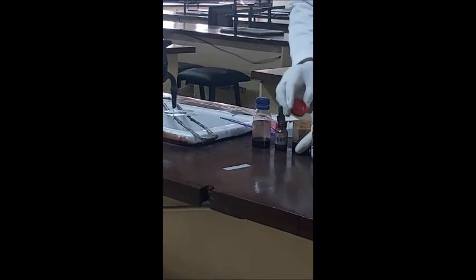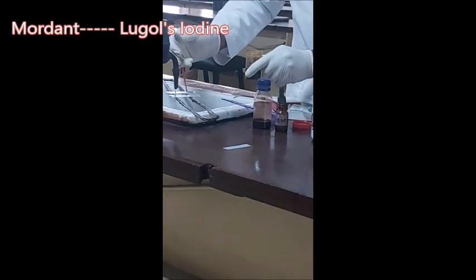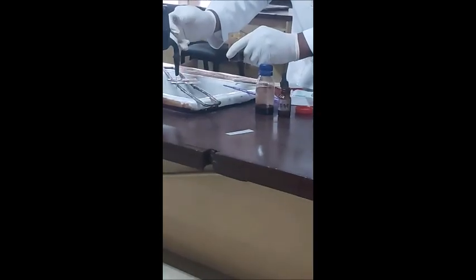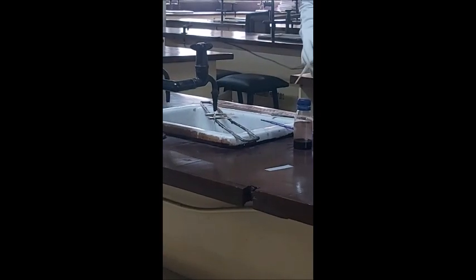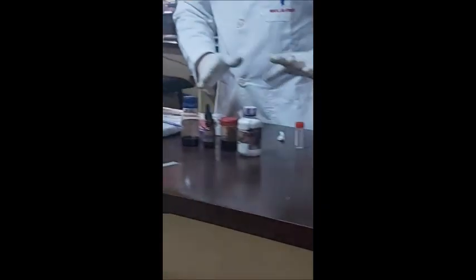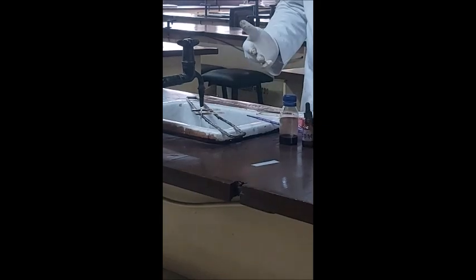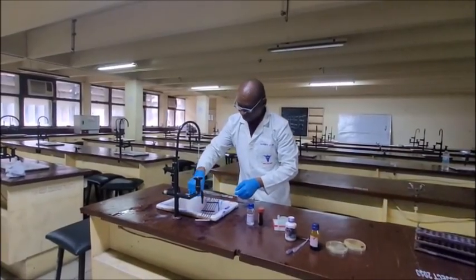Having done that, you go back to the stains. The next stain you are going to use is the mordant, which is Lugol's iodine. Lugol's iodine acts like a bridge connecting one component to the other. Flood the whole surface of the smear with Lugol's iodine and allow the stain to remain on the slide for about 30 to 60 seconds. Then rinse again under running tap water.